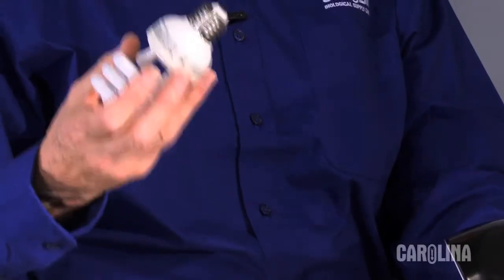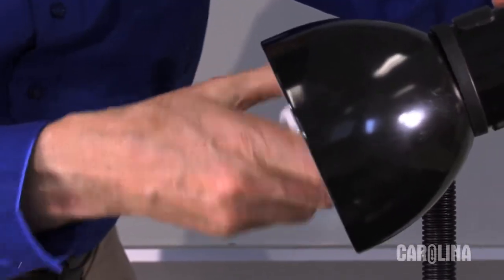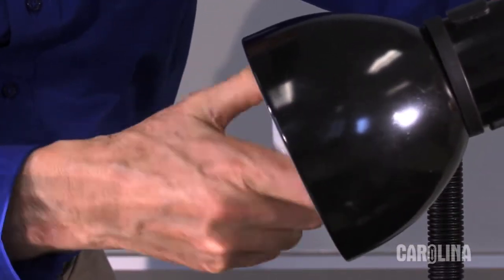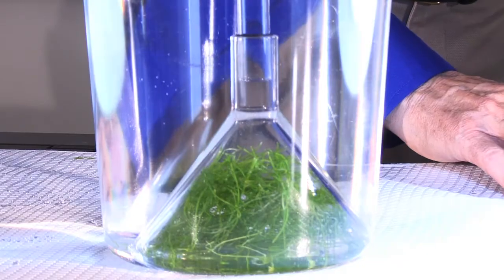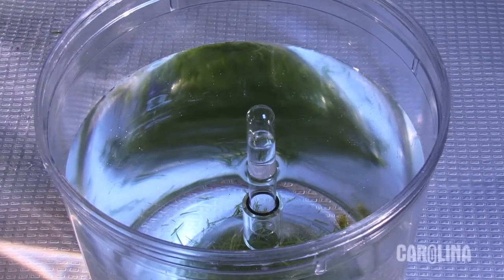Now we'll add a light source. For this demonstration, I'm using a 20-watt fluorescent bulb. Now, turn on the light. It takes about 24 hours to fill the tube.